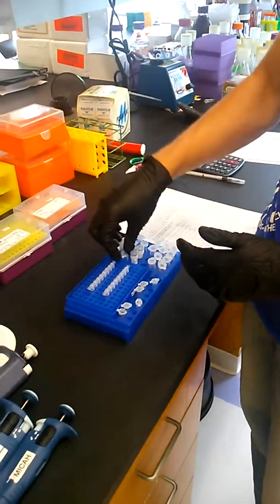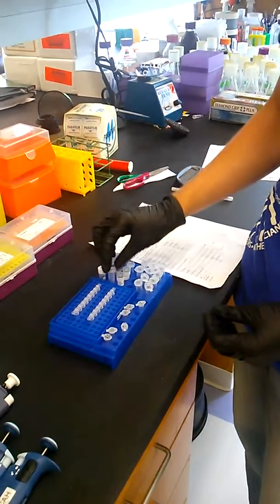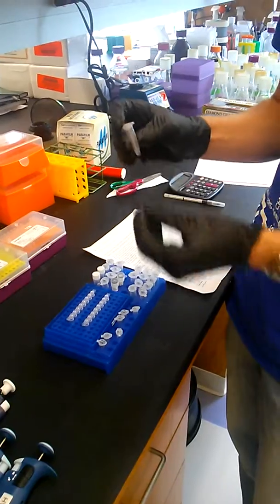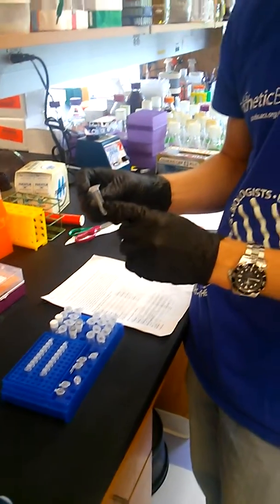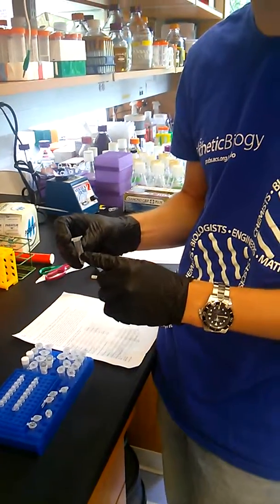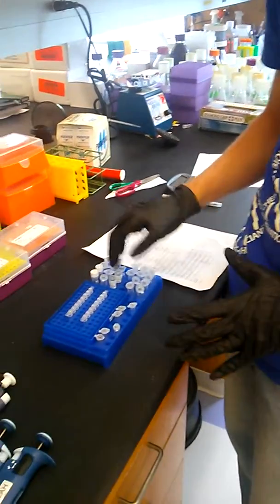So I'm using both genomic DNA directly from a colony. And as a control to make sure my PCR is working as it should, I have some genomic DNA that was purified using a kit. So you need a template.